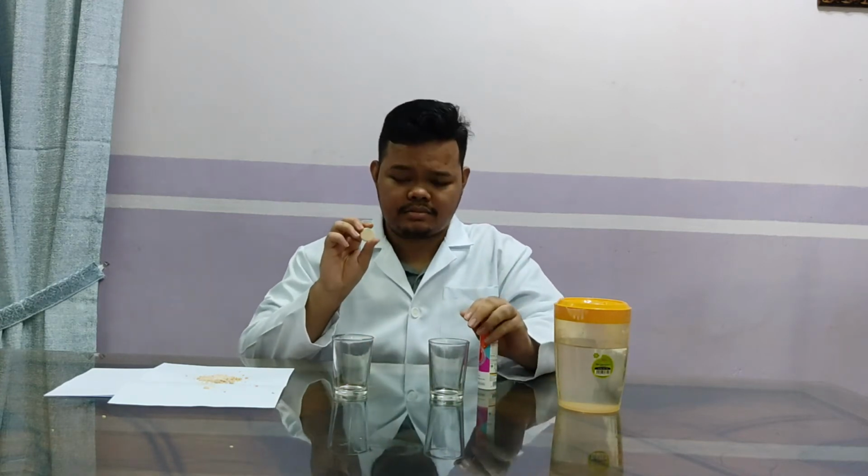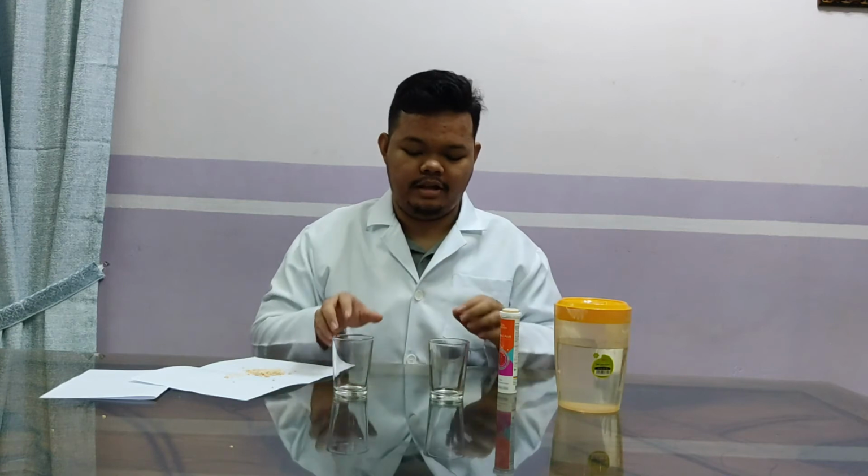I have used vitamin C in tablet form, or pill, but you must crush one of the vitamin C. You must crush the vitamin C because we need to see the difference between the two vitamin C. The smaller the size of the atom or substance, the higher the surface area. Okay, let's start the experiment.